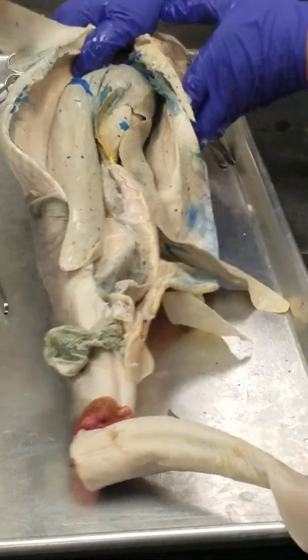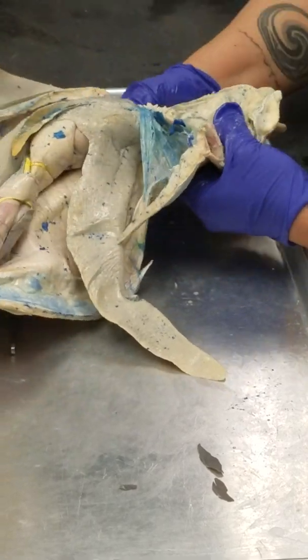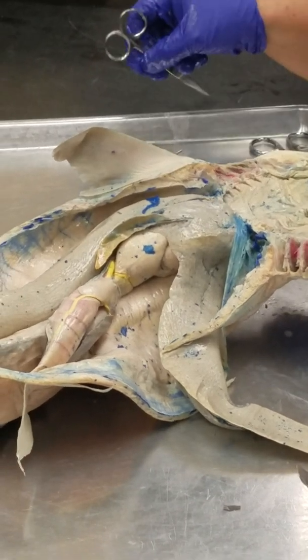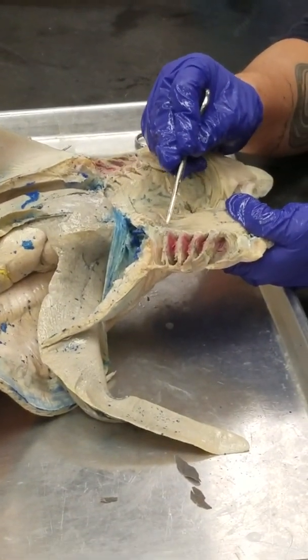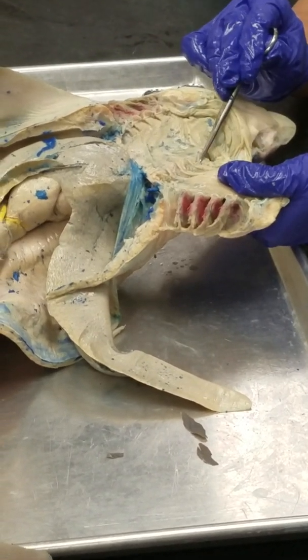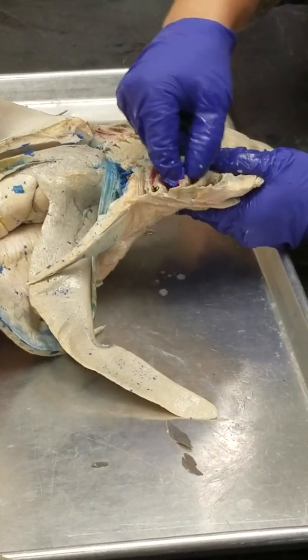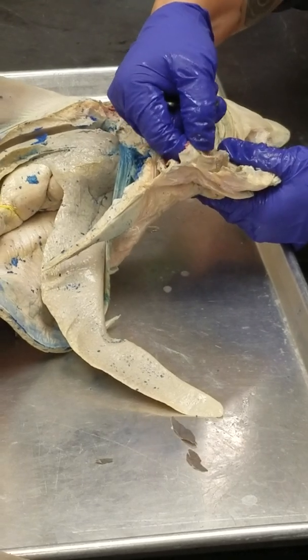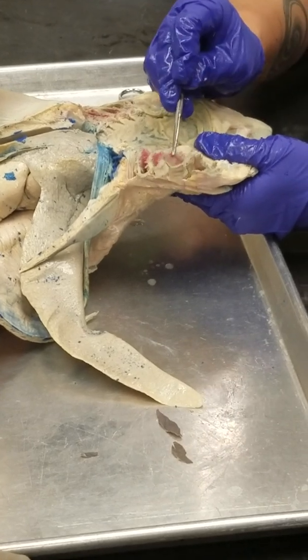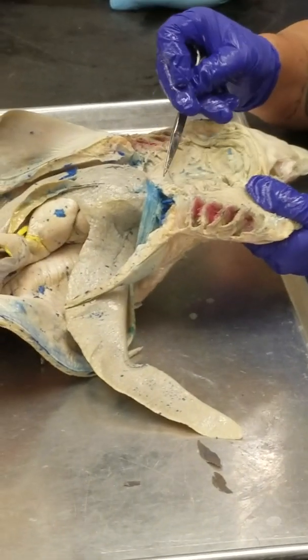Okay, so in order to see some structures, I'm just going to rip open this here. So look, we can see I cut through all of these gill arches, right? So we can see inside the gill arches. Each gill arch holds these feathery looking things. They look like they have a lot of folds. These are called gill filaments. So the gill filaments have, see these pink vessels? They have all these gill capillaries, and that's where gas exchange takes place.